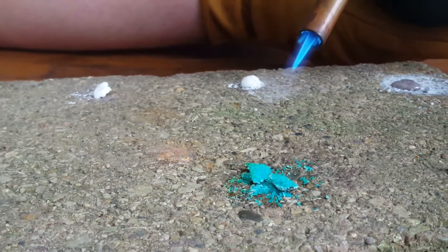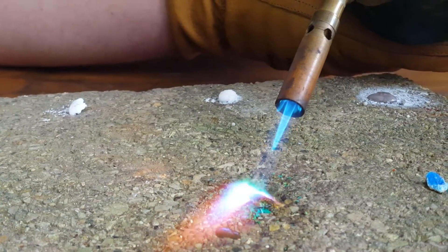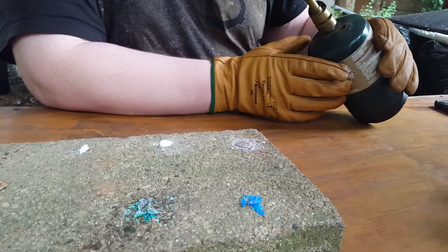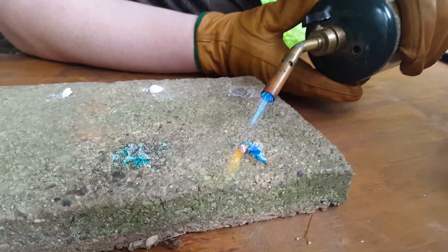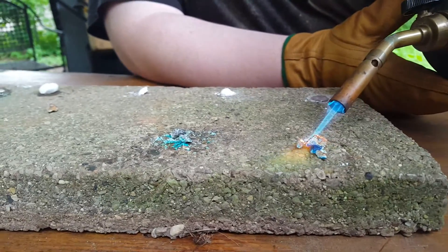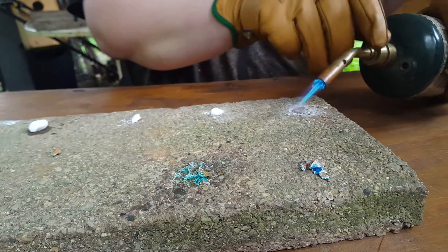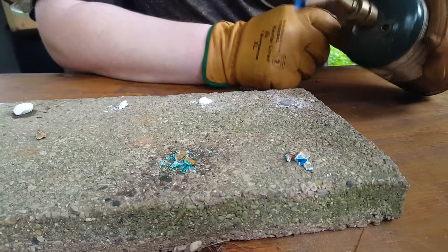This salt is cupric chloride, which burns with a blue-green flame — you can see a little bit of purple in there as well. And this next salt is copper sulfate, which burns with a more green-yellow flame than the copper chloride. This is because the copper chloride was bonded to a halogen and this one is not, so the halogen is part of what causes the more blue color for the copper chloride.